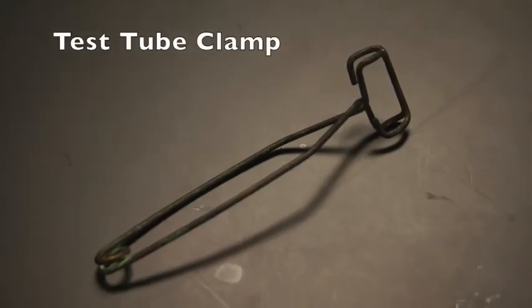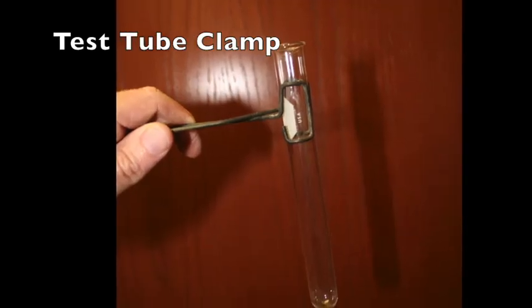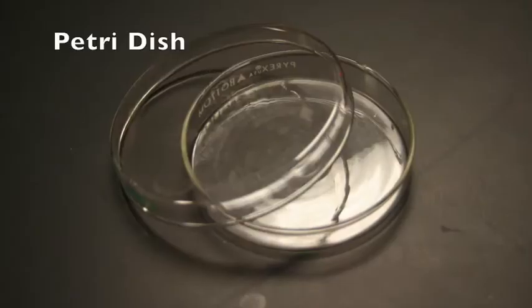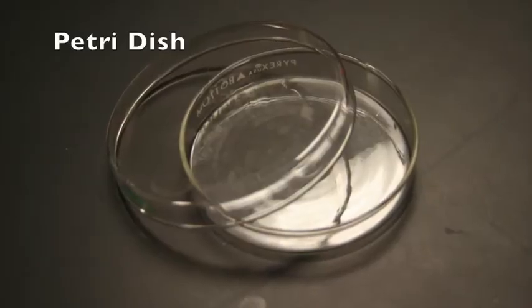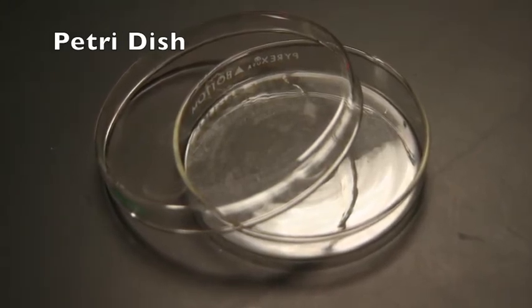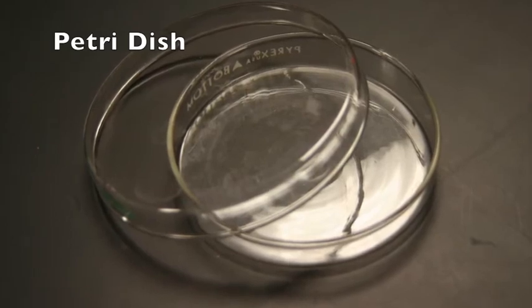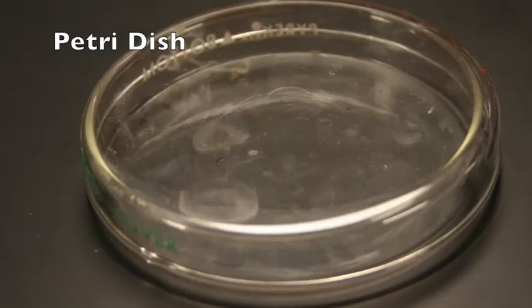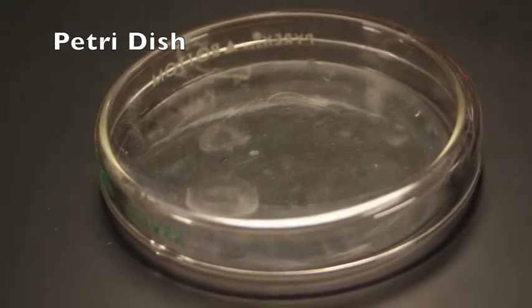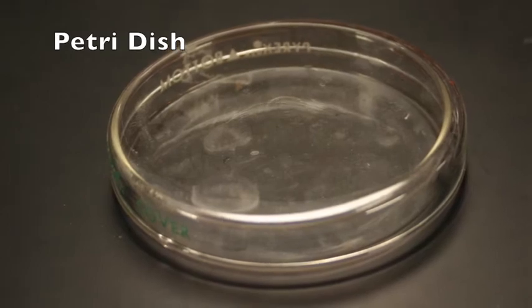The test tube clamp is useful in picking up hot test tubes. Squeezing the clamp will release the test tube. Therefore, it should not be held too tightly. The Petri dish is a container with top and bottom halves that are separate from each other. The top half has a larger diameter and surrounds the bottom half when placed over it. Culture specimens may be placed inside and easily covered in order to prevent the specimen from escaping and to prevent contamination by other organisms such as bacteria from the surrounding environment.